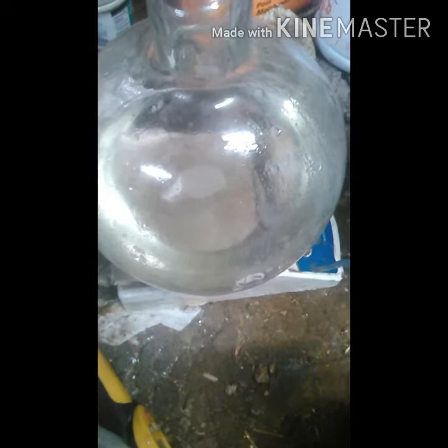Now I'm going to add sodium hydroxide to this solution slowly over a period of time until I achieve a pH of 14, because at that point all the lidocaine should be crashed out. And then I'm going to start filtering it.